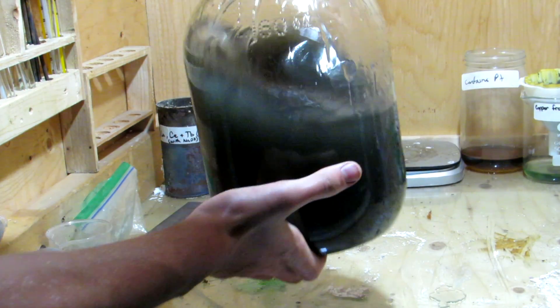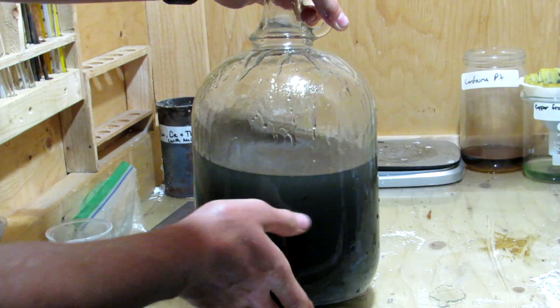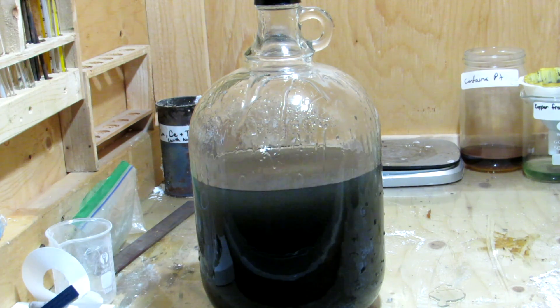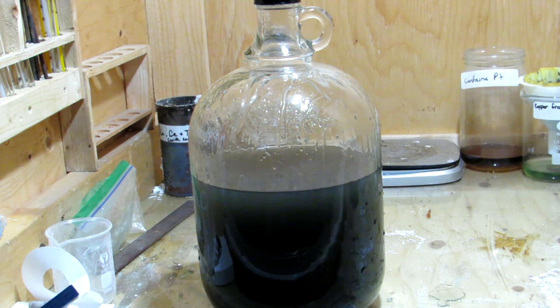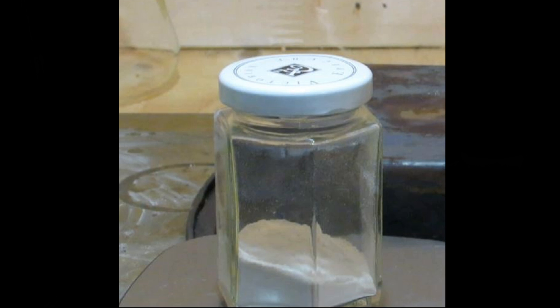If you're wanting to use the sodium silicate to do the chemical garden reaction, you should use the pure silicon dioxide we made in a previous video so that a nice clear solution of sodium silicate is obtained.